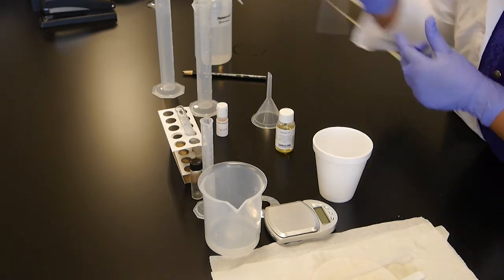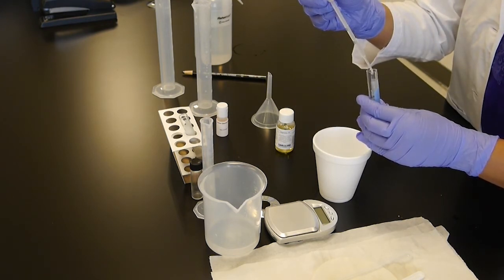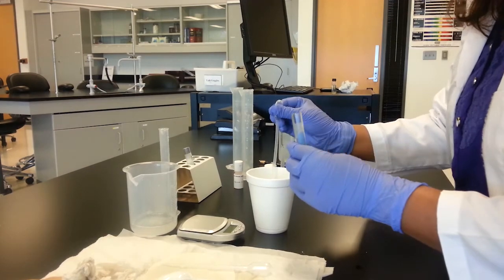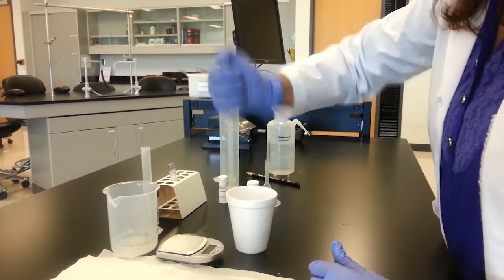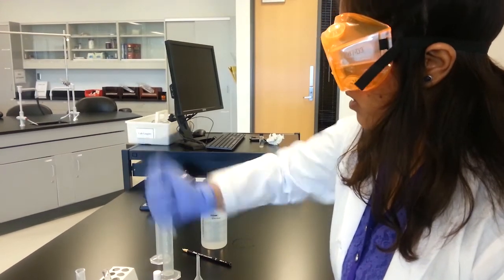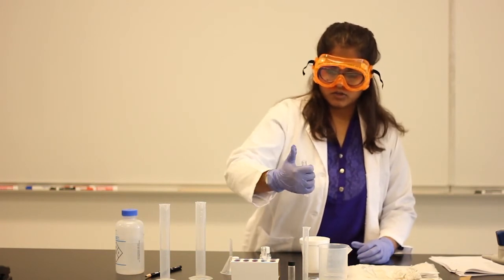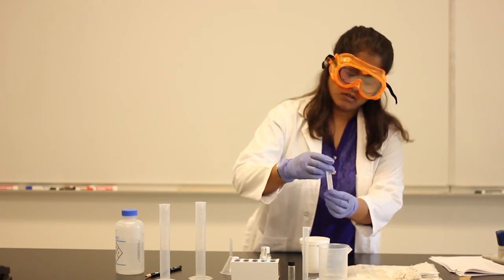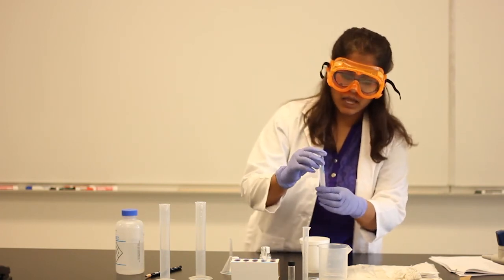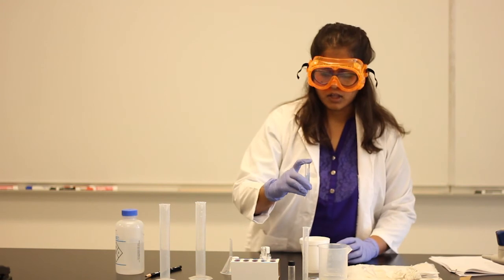All right, how much am I going to take? The test tube 2, let's take about 20 drops. There you go. Let's shake it. Because soap is supposed to remove the chemical substances that make the water hard water. So, see the foam layer formed? It'll be different for each person based on how much soap you got and what's the pH, but make sure to take a photo of the foam layer formed and write it down on the data table.